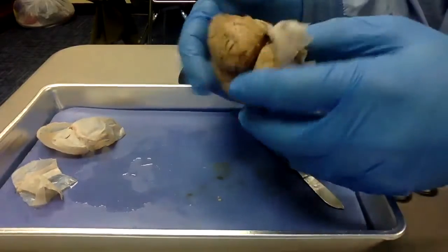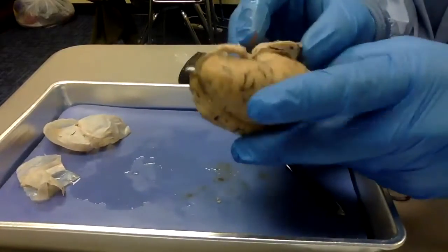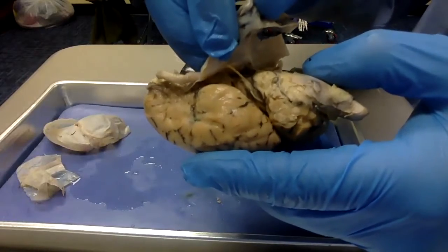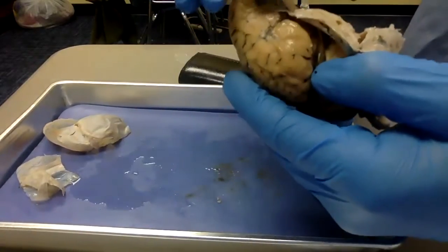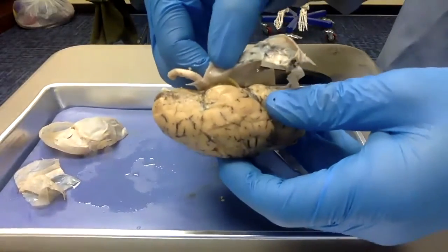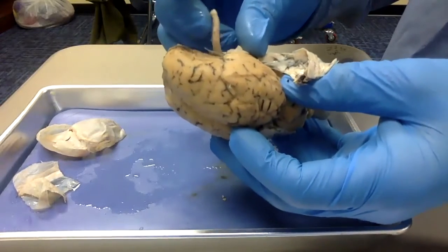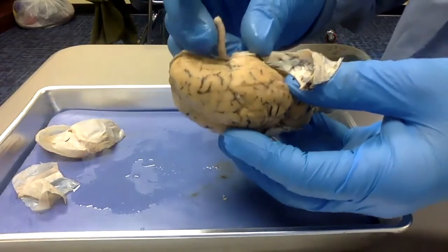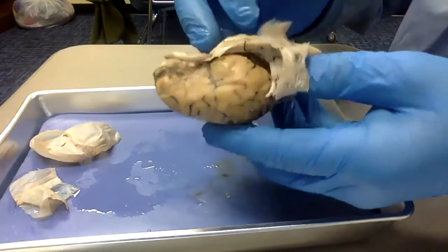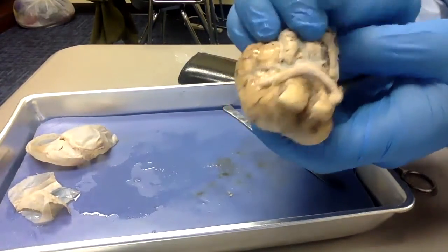We got an idea. But another thing I want you to see before I continue cutting is, and I've never been able to get this really well without ripping this before, so you guys are in luck. You see that string looking thing right there? That's the optic nerve, right? It's coming in through there and out there. So you can actually see it go toward the outside. So it's not as thick as it looks. It's so thick right here because of the dura mater covering. But in here, it's actually pretty thin, compared to the olfactory nerve, which is super, super thick right up in here.